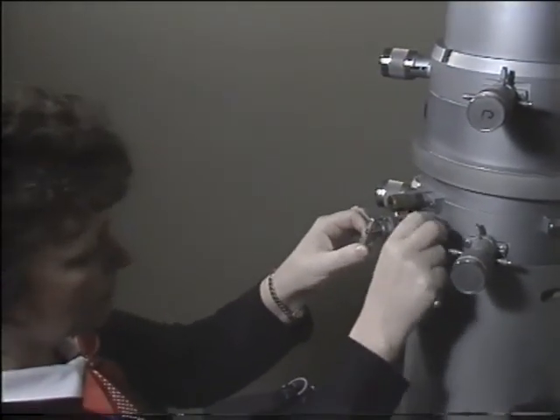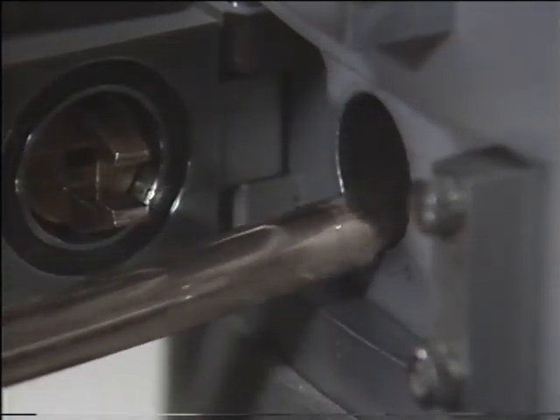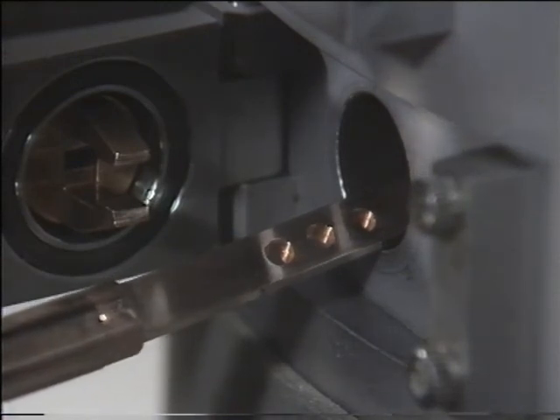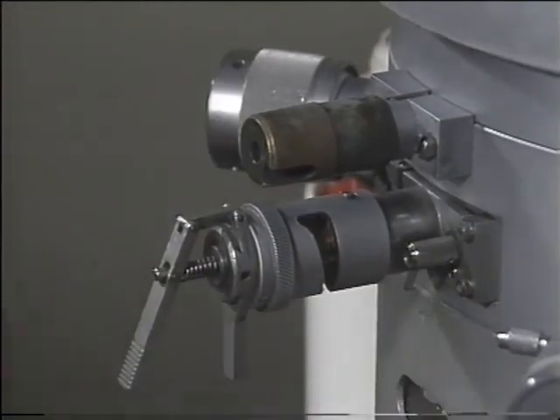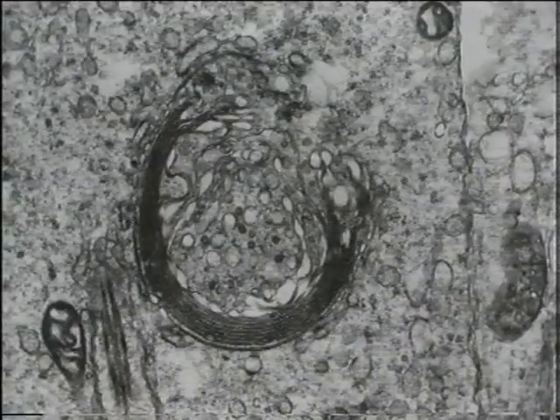Most biological materials can be examined in the electron microscope using one or more of these techniques. Because more structural detail is being revealed all the time, more is being learnt about the form of living things and the relation of form to function, whether in man, microorganisms, or molecules.